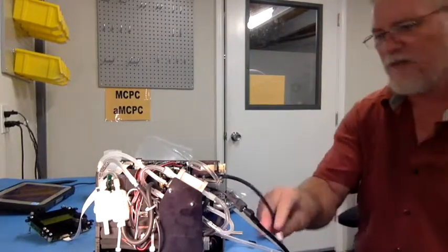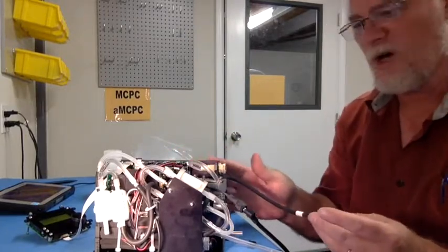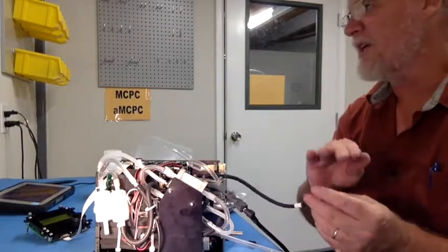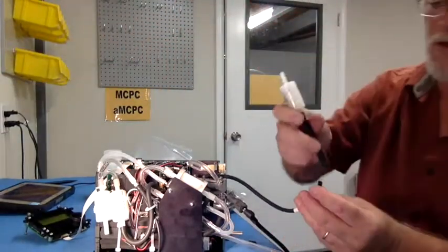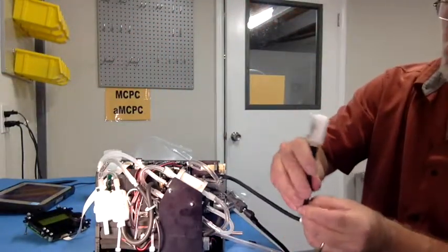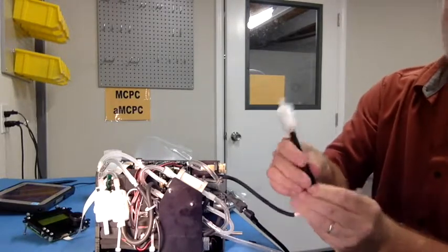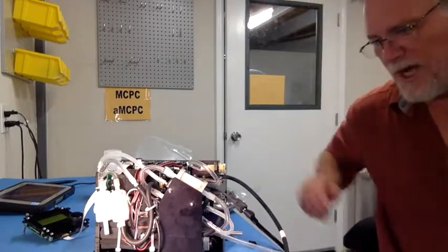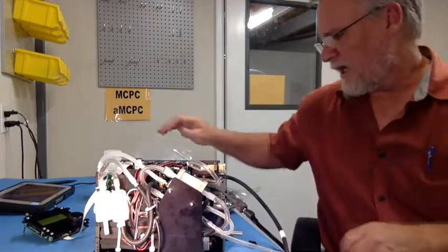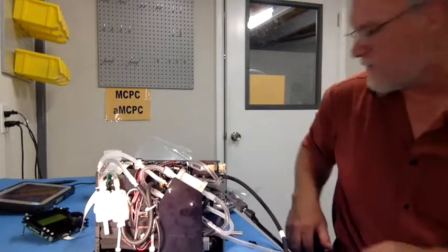So you can hear the vacuum pump going on now. This unit doesn't have any butanol in it, so I'm not worried about breathing this. One thing you can do to reduce the noise is simply put a filter on this tube. That will help dampen the noise so you don't annoy your lab mates. And then let me show you a couple of the other hookups real quick.